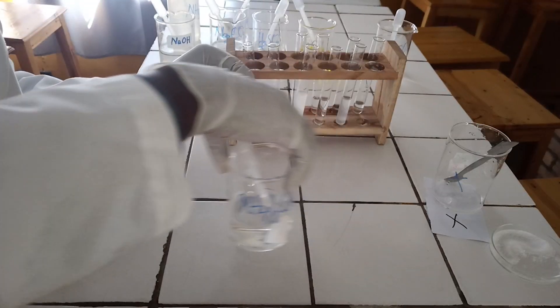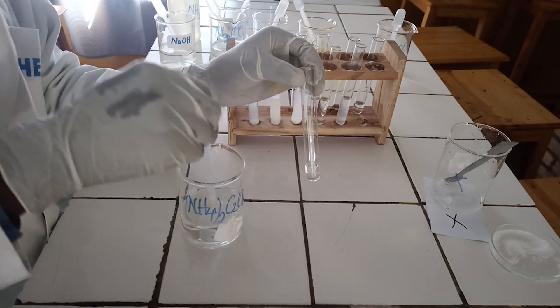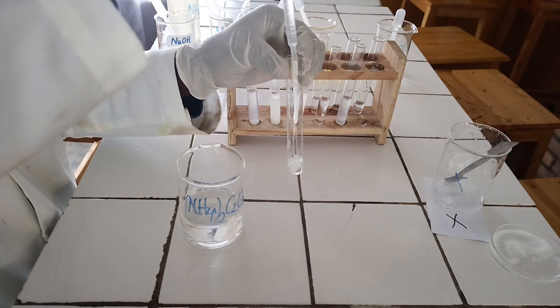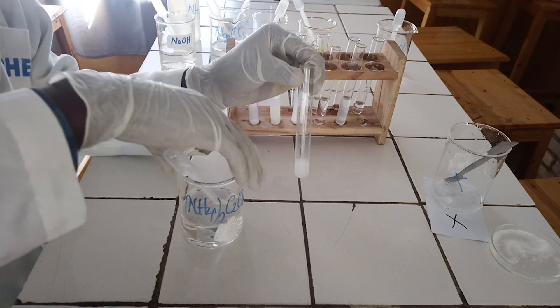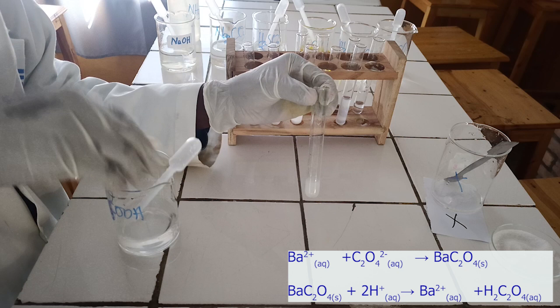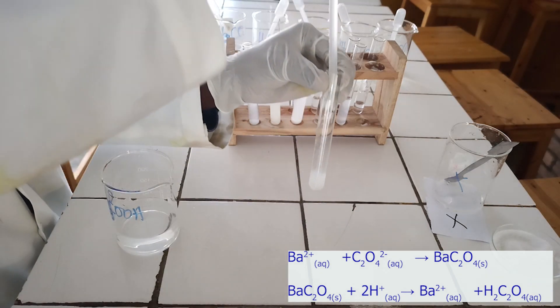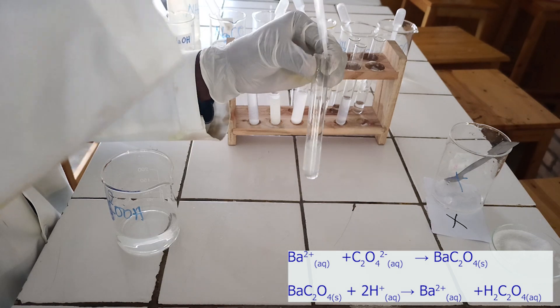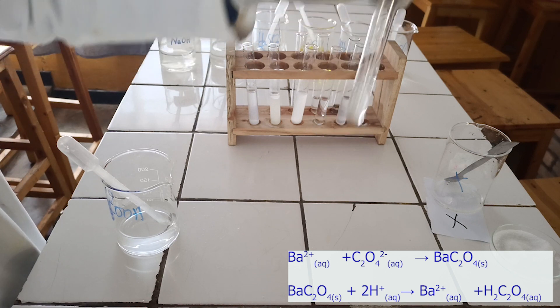First confirmatory test. To the sixth test tube, add a few drops of ammonium oxalate solution followed by acetic acid. As you see, ammonium oxalate reacts with barium ion to form a white precipitate, which is soluble in acetic acid solution. Below, there is the ionic equation for this reaction.